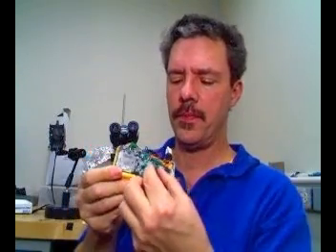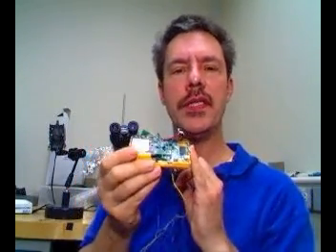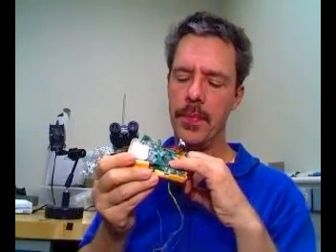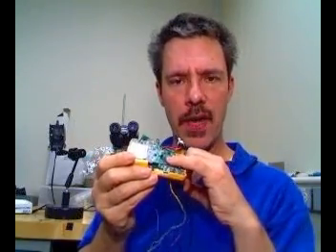We will take an inexpensive 5 megapixel digital camera, we will remove the lens to reveal the digital imager chip, which has a glass protective cover.